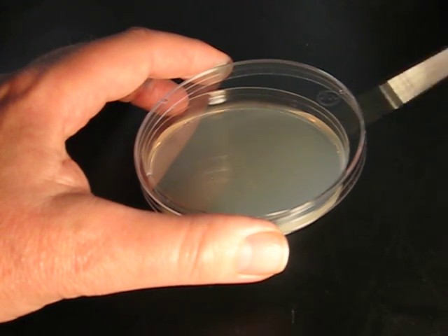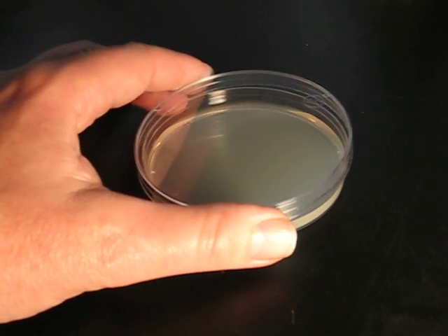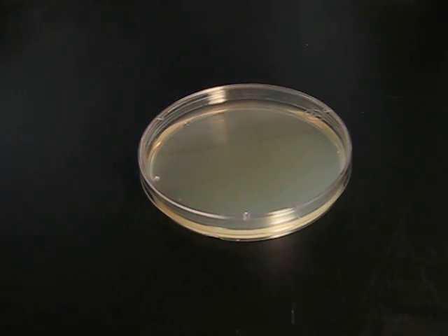So far we have only streaked across half of the plate. Eventually we want to cover the entire plate.